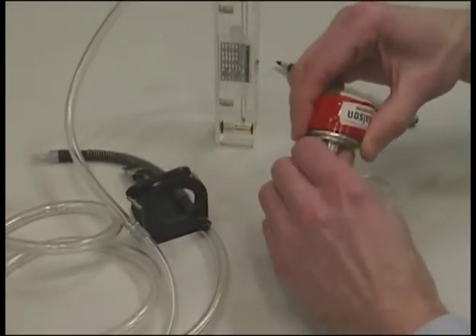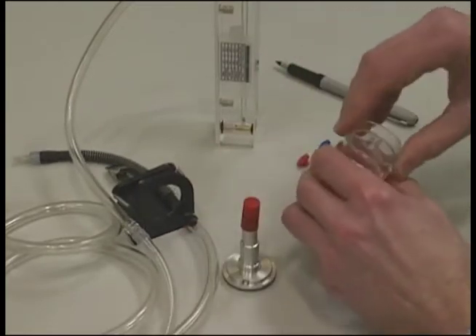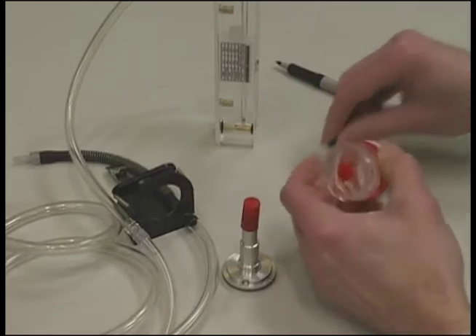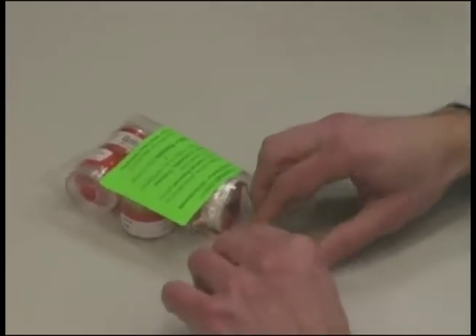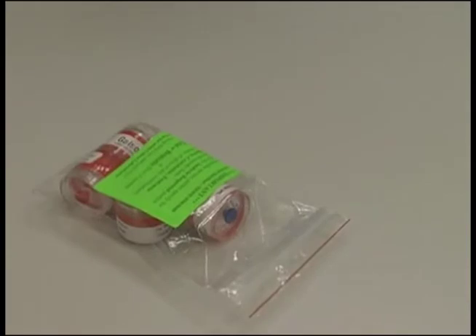Remove the cassette and the cyclone from the cassette holder, and reassemble the cassette with the top of the filter holder to preserve the sample. Wipe off any dust accumulated on the cyclone prior to shipment back to the laboratory. Reinstall the nibs on each end of the cassettes and place the cassettes in the Ziploc bag for shipment to Galson Laboratories.